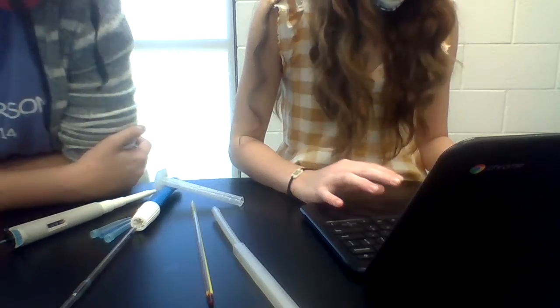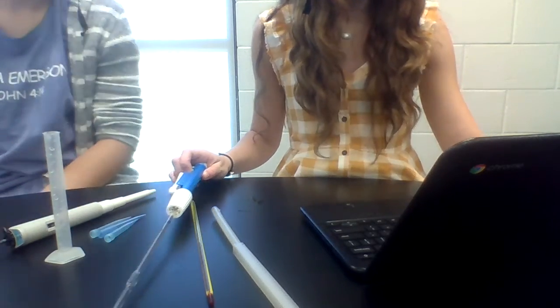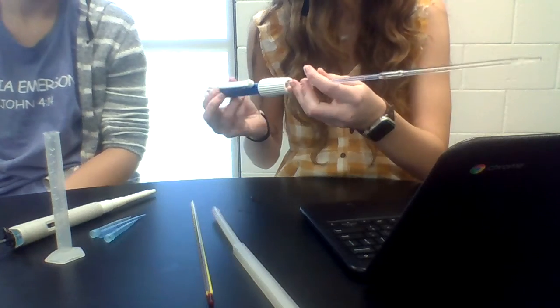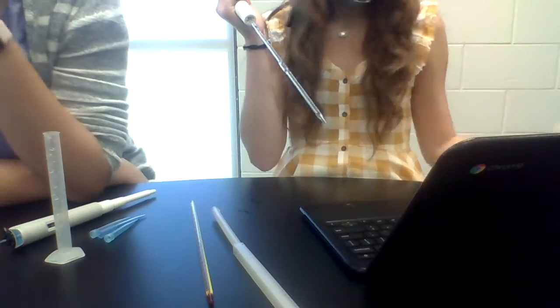Okay, hold on, so we're then doing this again, add another. Hey, you weren't videoing that, were you? Or we could just keep pouring until it hits. Did you mess up? I sprayed it on the back. It clicks. Or we could just keep pouring until it gets where it's supposed to.